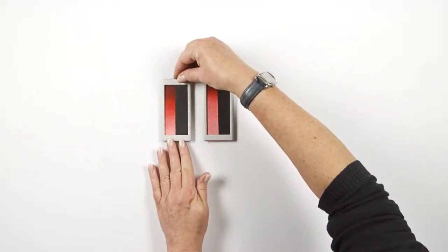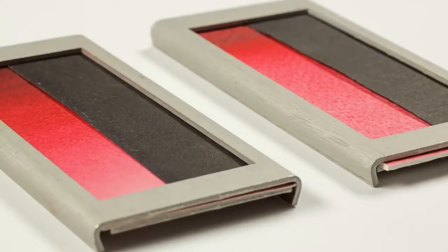The washes of each are cut to size and one half is masked before placing in a lightfast testing machine.